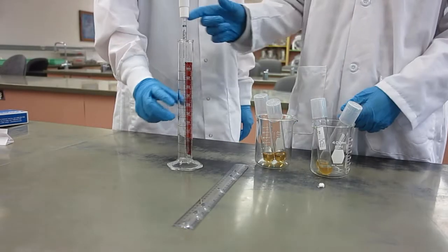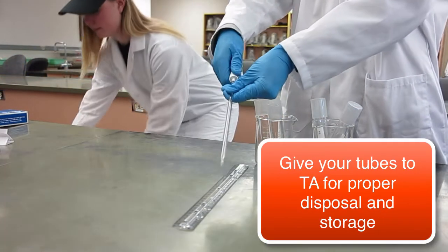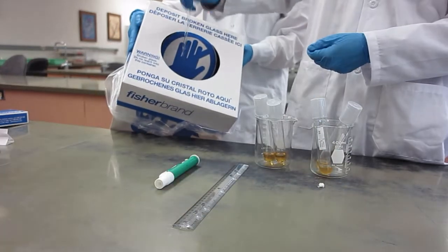Dispose of your used glass pipette in the glass disposal box. Give your TA the old culture tube for proper disposal. Throw the used parafilm in the trash. Repeat the same process with the other sample.